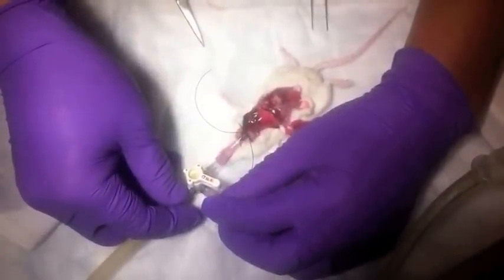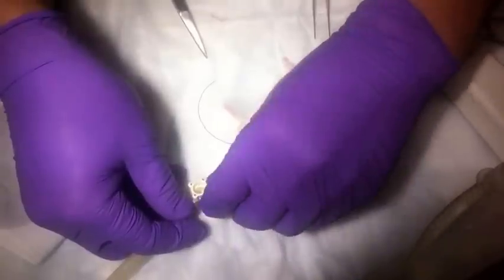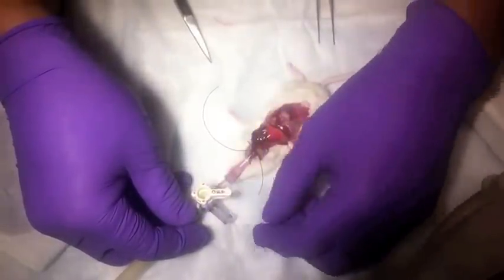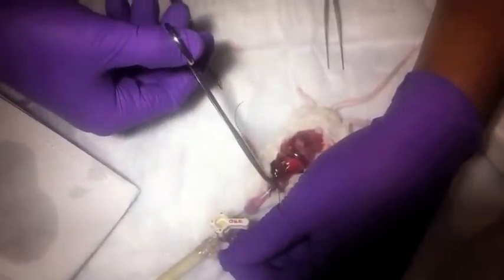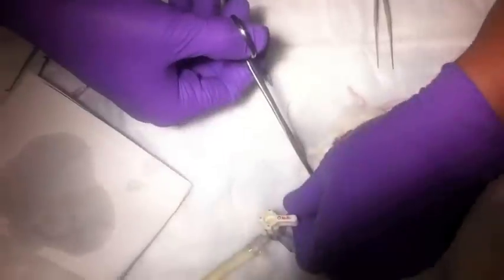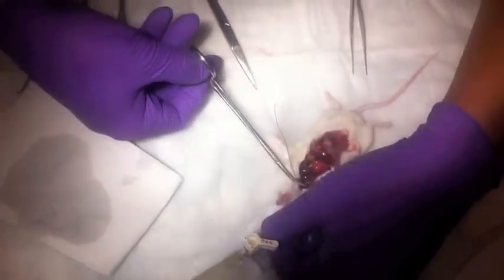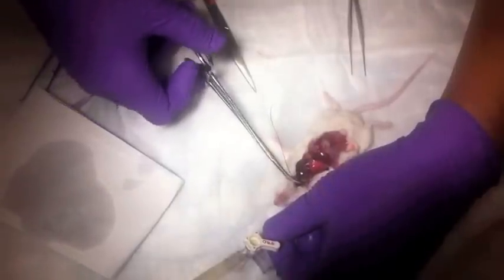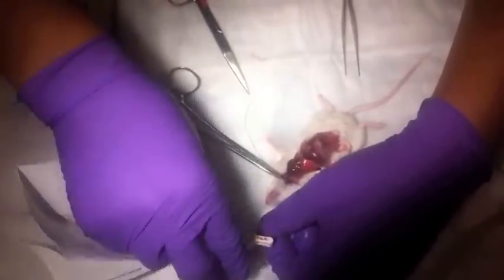After five minutes — or whatever length of time you choose under pressure — turn the stopcock off. Now we're going to take the needle — the stub needle — out of the trachea. With a forceps, grab the trachea around where the needle is, and by pulling the needle out, immediately grab and clamp the trachea. The lung is now sealed. Take the tie already placed around the trachea, tie it off, and then remove the needle.